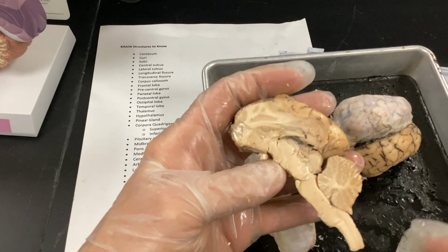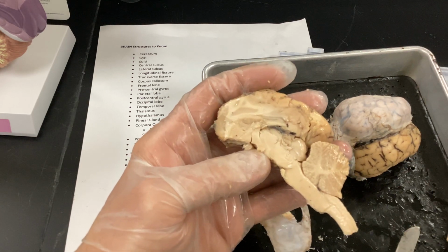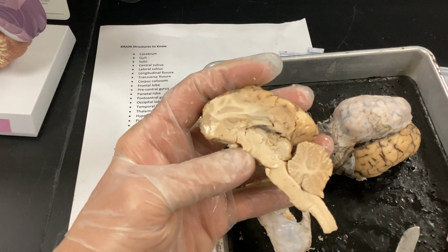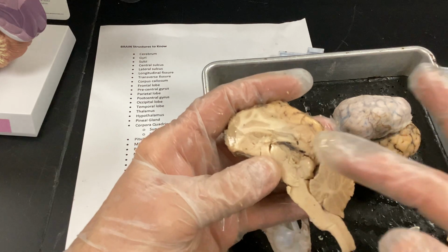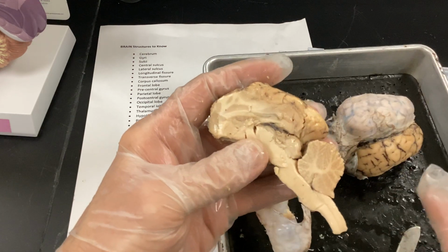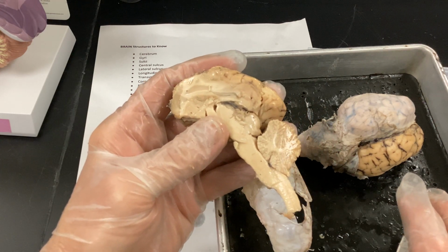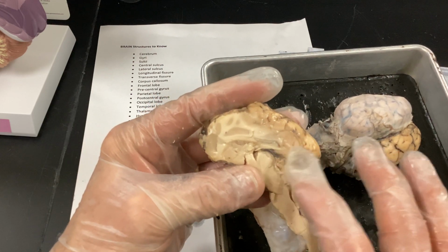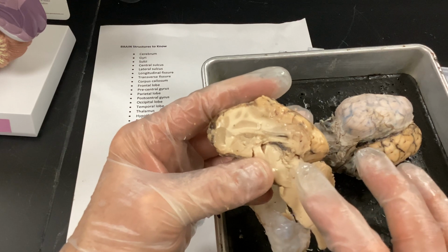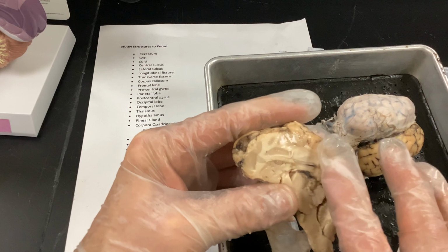And remember, I said in lecture that it has to go through the thalamus. The thalamus is going to edit literally 90% of that information. So you really have to know where the thalamus is and realize that it's going to stop 90% of the information from going up further. All right. And then in lecture, we talked about the reticular activating system and how it literally can unplug information from the thalamus going up when you're sleeping. But the minute it is aroused or woken, it sends that information up to the cortex, and you are wide awake.